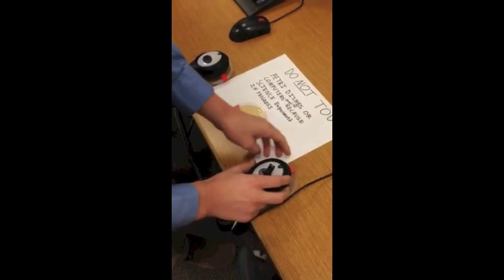This was our setup for the growing of E. coli cultures. We had headphones playing music for our two experimental petri dishes. The petri dish on the right is listening to classical music, while the one on the left is listening to death metal, both being played from computers. And there is our control petri dish.